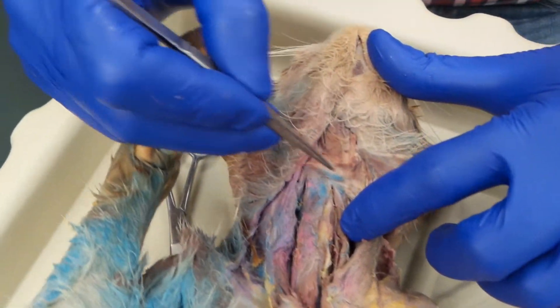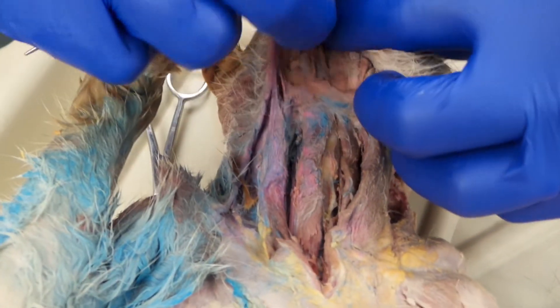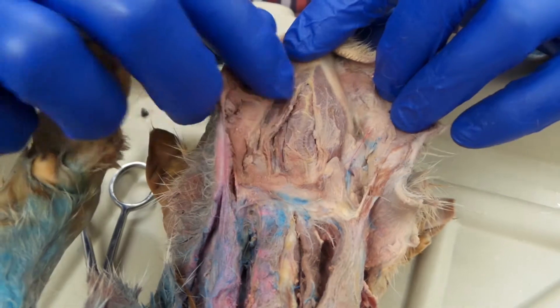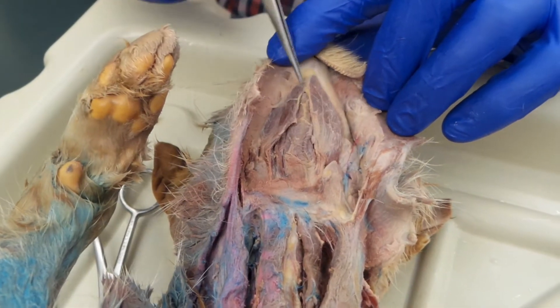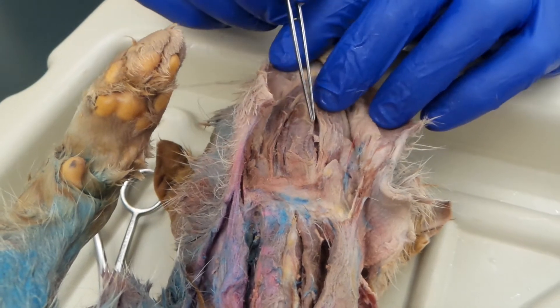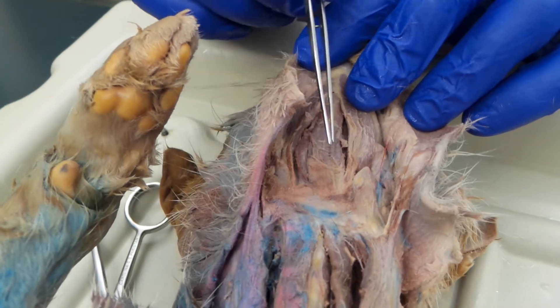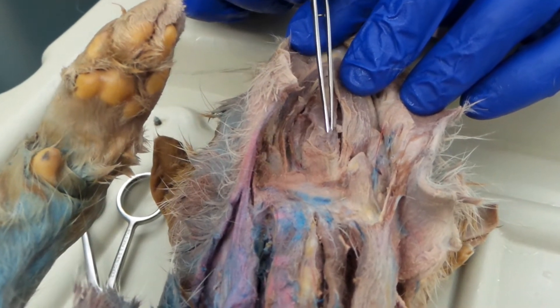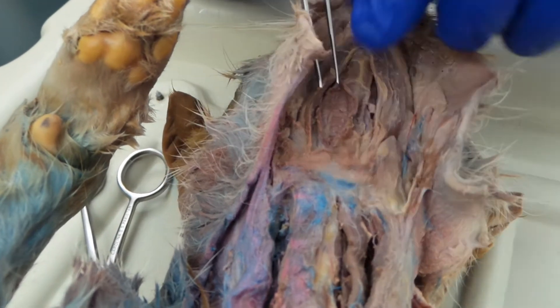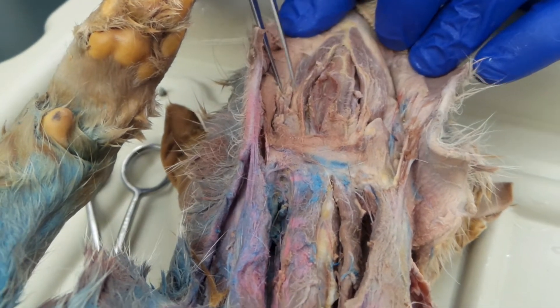On the other side of this vein right here — the transverse jugular — kind of work our way up to the bottom of the chin. And we can see right here, running along the mandible, we have the digastric. Running across between the digastric, kind of transversely, is the mylohyoid. If you cut a window in the mylohyoid, right below it is the geniohyoid.